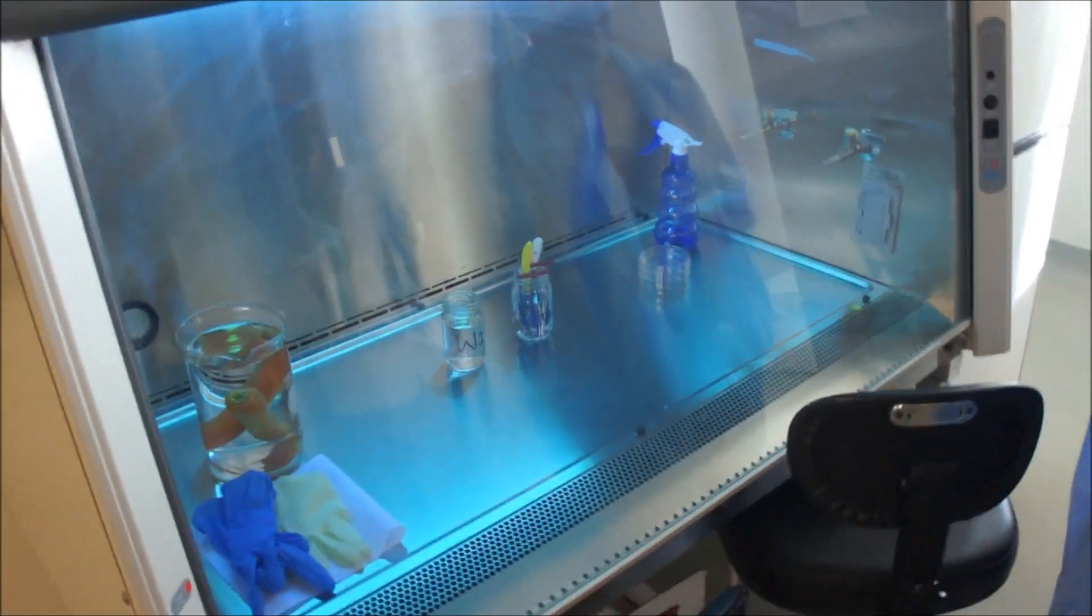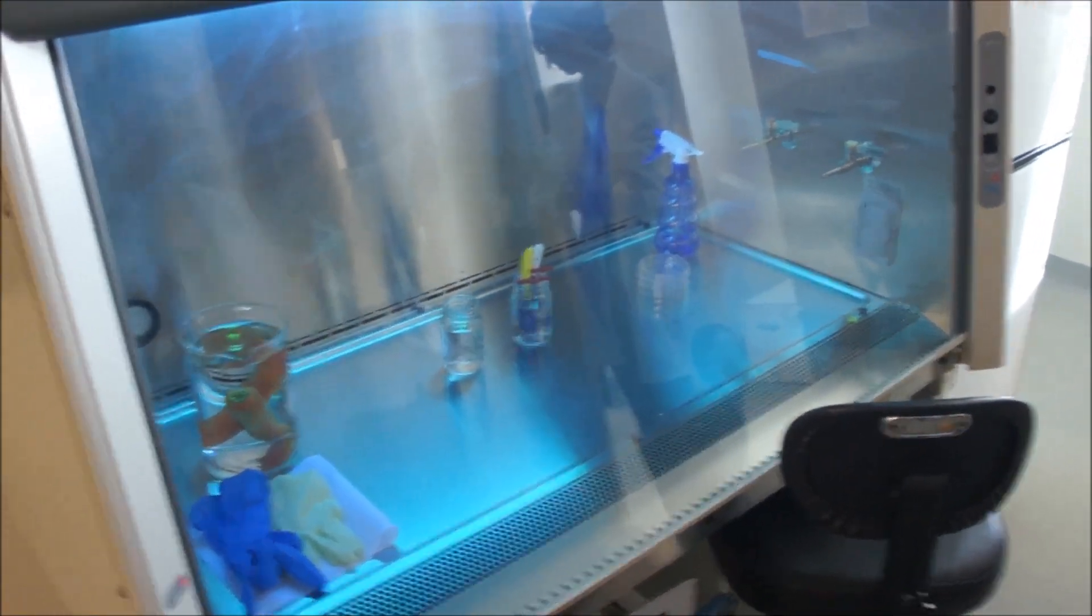Take the roots to the sterile work area, use sterile technique for the remaining part of this procedure.